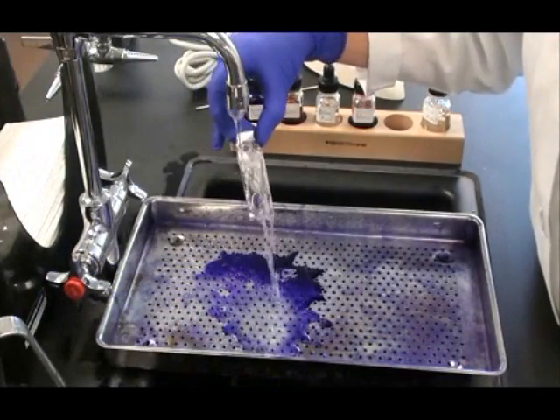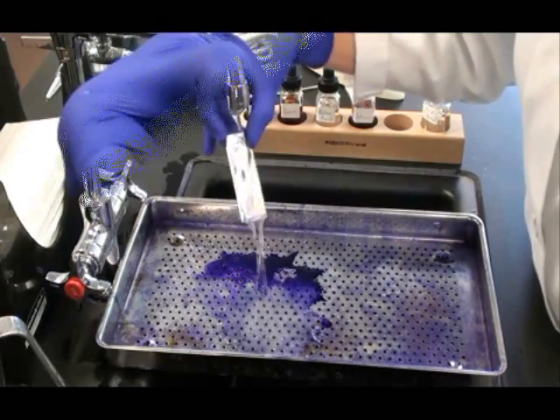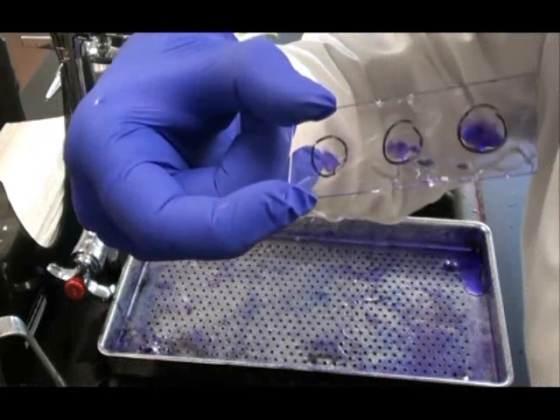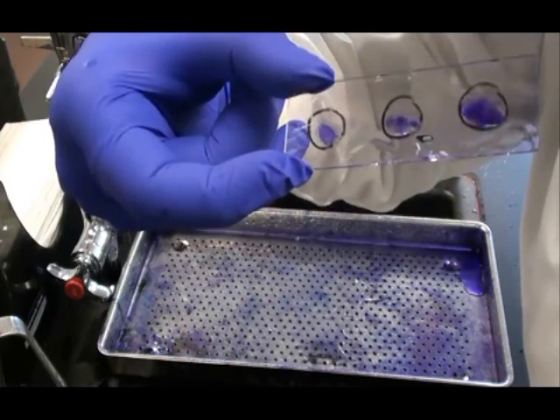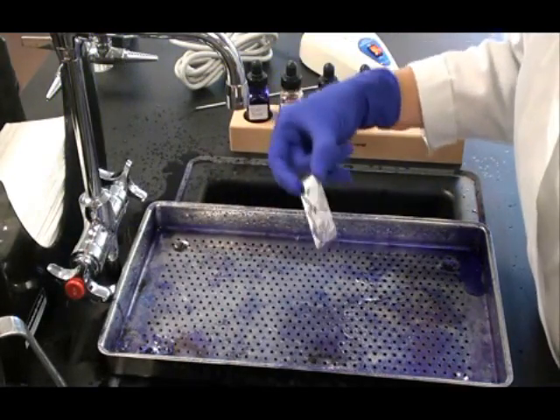After one minute I rinse. I want to continue rinsing until the water coming off the slide runs clear. At this point all of my samples are stained purple with the Crystal Violet.